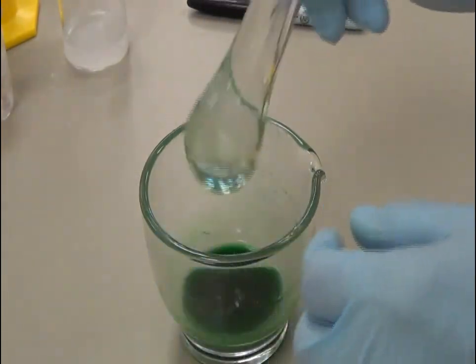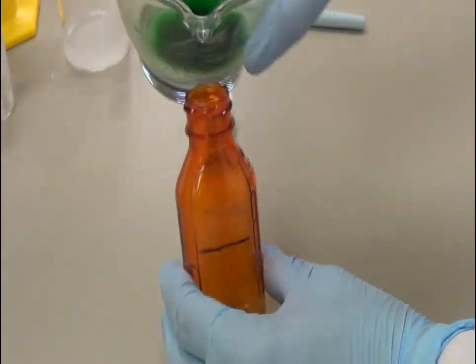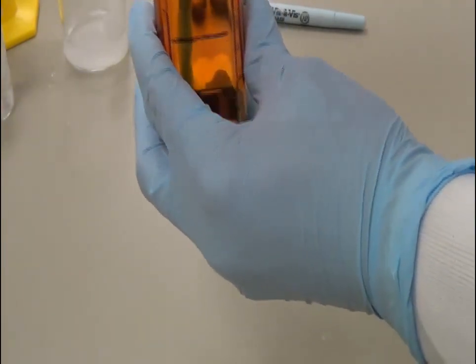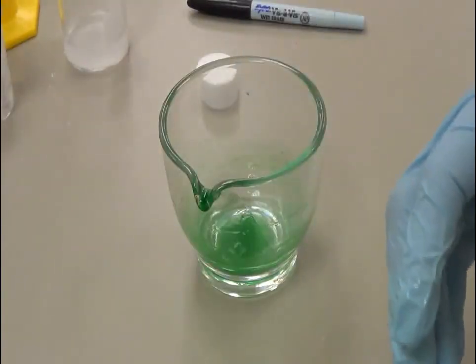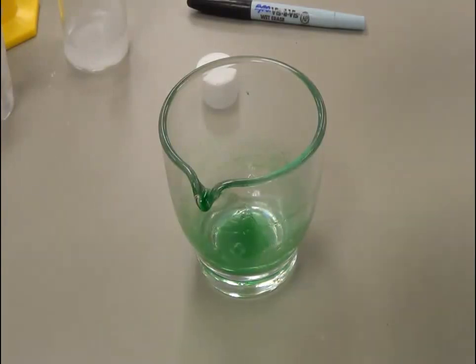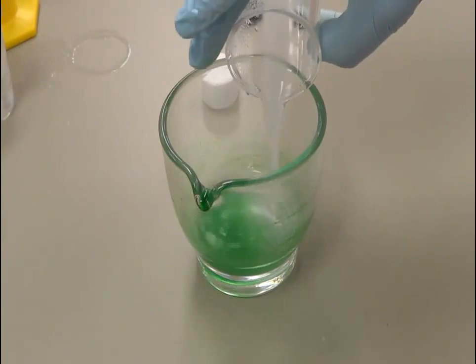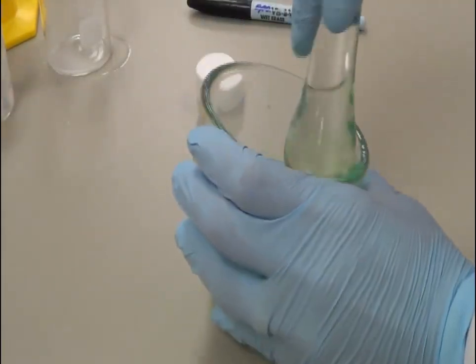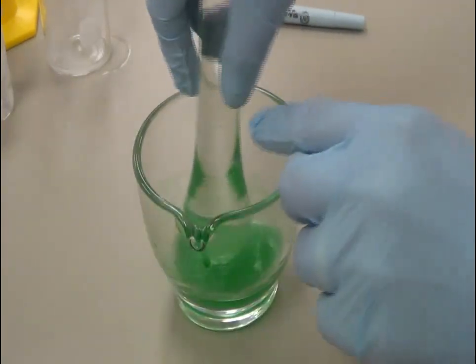Now slowly I am going to pour this into the bottle which we calibrated earlier. I am going to pour the drug back into my bottle and use the rest of my 15 ml to scrape the leftover and collect all the remaining drug.